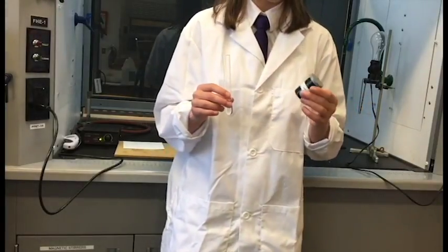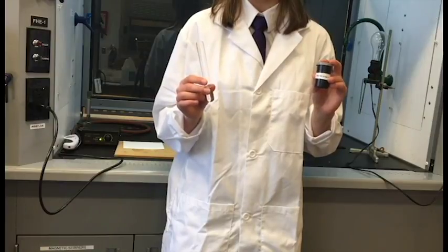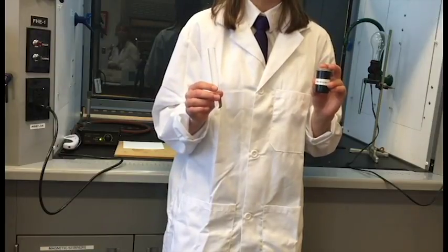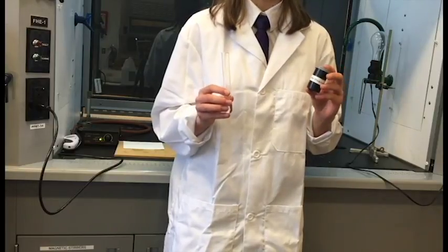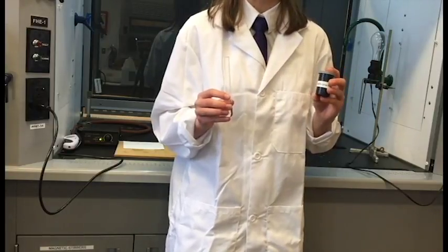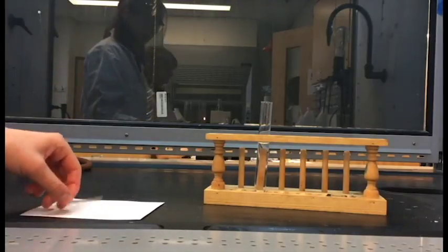For this next demo, we're going to place a piece of magnesium ribbon and some hydrochloric acid. And this single displacement reaction will form hydrogen gas and magnesium chloride. We're going to test for the hydrogen gas with a burning splint test. So now we're going to put in the magnesium ribbon.